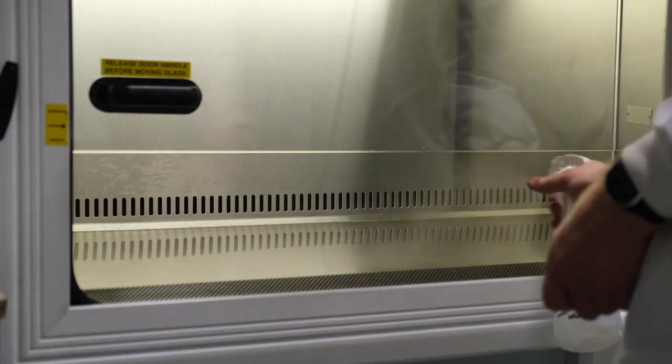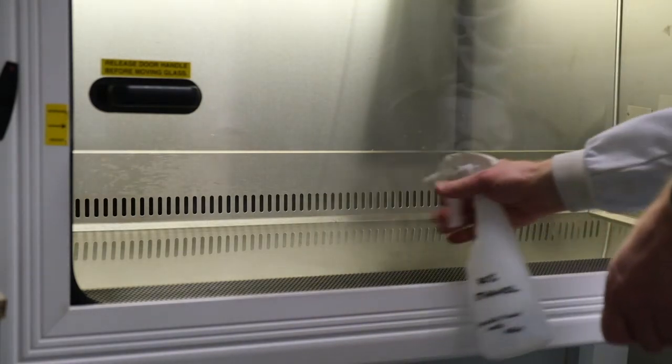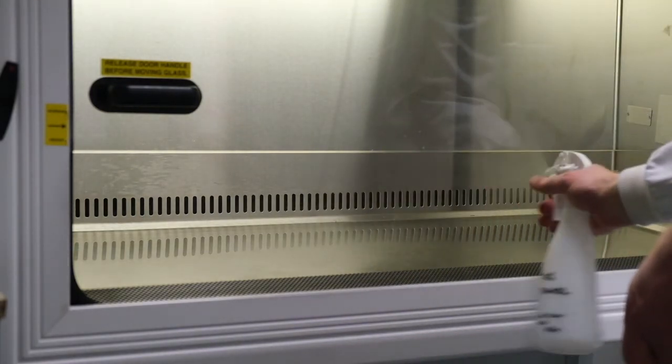We'll pour our plates in this laminar flow hood. Sterile air flows through this hood, preventing any microbes from falling on our plates.